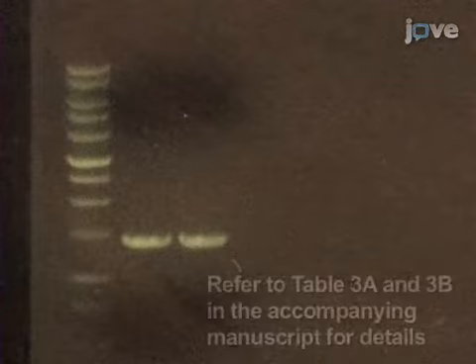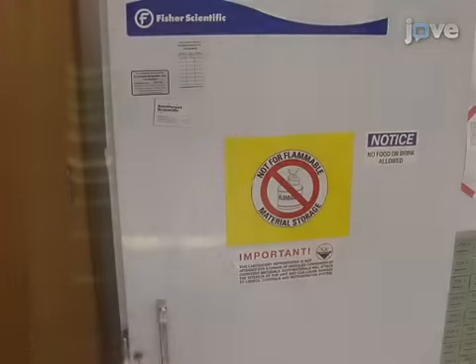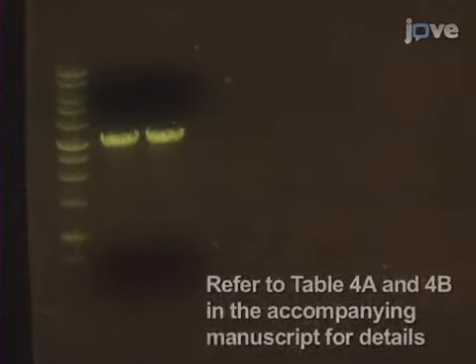In this procedure, after amplifying the long terminal repeat 5' UTR region of the MJ4 plasmid, visualize the 1.3 kb PCR products on the illuminator. Excise the positive amplicons, then purify and freeze them as previously described. Next, create the fused MJ4 LTR GAG amplicons via Splice Overlap Extension PCR. Visualize, excise, purify, and freeze the 3.2 kb long amplicon.